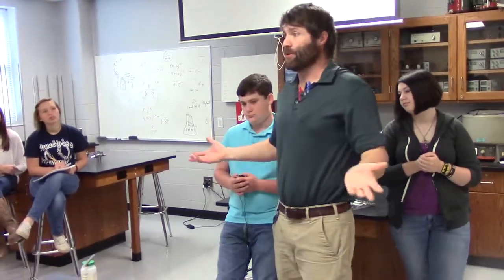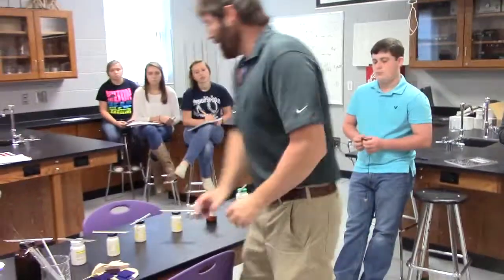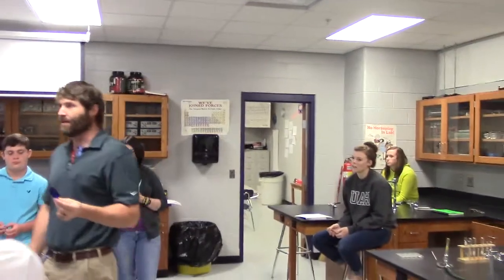You got the general idea of what you're doing tomorrow, right? You're burning the chemicals, writing down what the colors are, making sure you clean your loop, that kind of stuff. A lot of people say that sodium and potassium burn the same color.